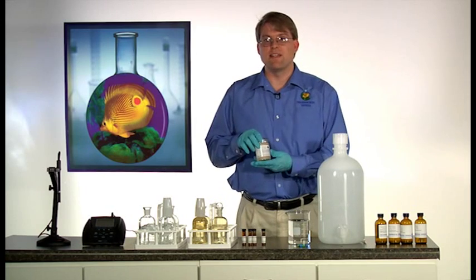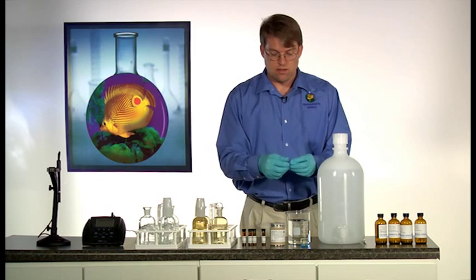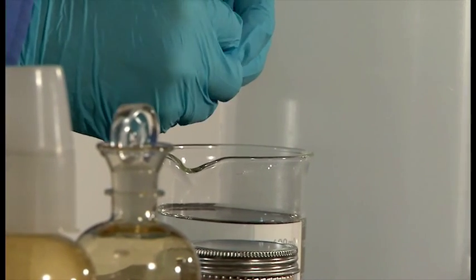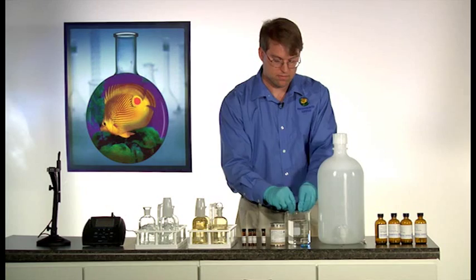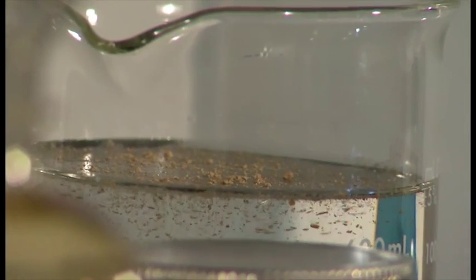To overcome these problems, use a freeze-dried seed such as poly seed. Simply place the contents of one capsule into 500 milliliters of your dilution water. More or less water can be used to adjust the strength of the seed as needed.